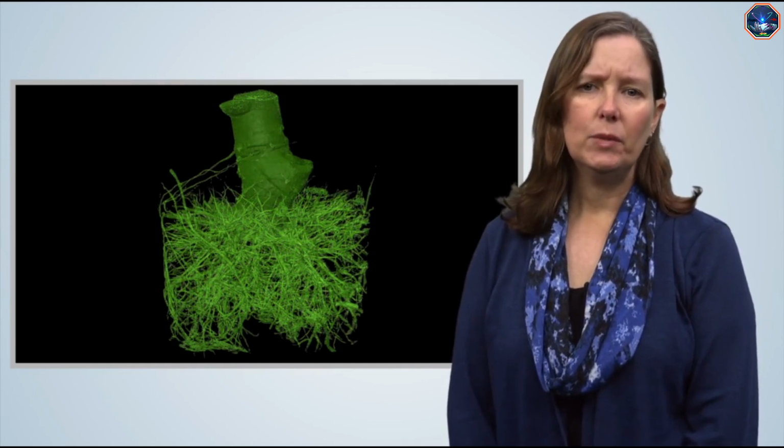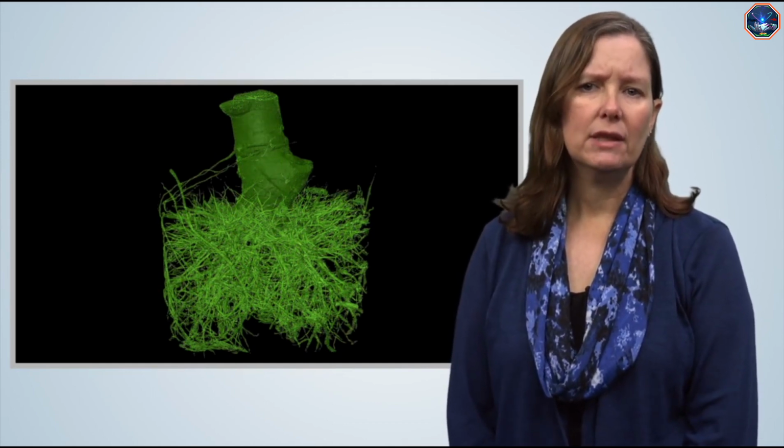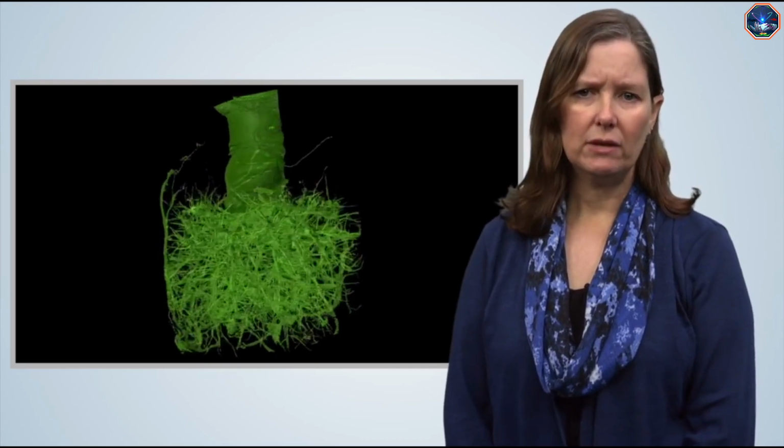The above examples are only a small slice of the types of research that use the micro-CT. Some other interesting applications include work on mummies, paintings, archaeological artifacts, and much, much more. Ariana will now show you how these different kinds of CT data are created for fossil samples.